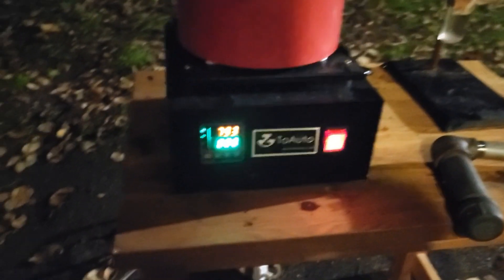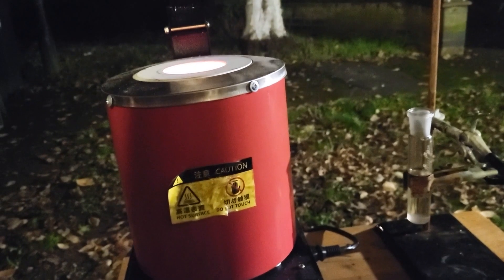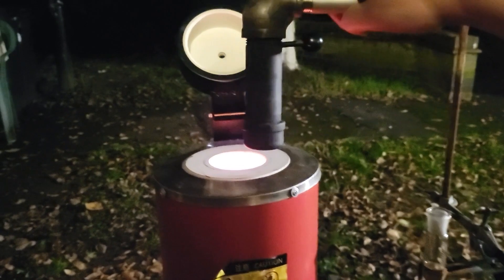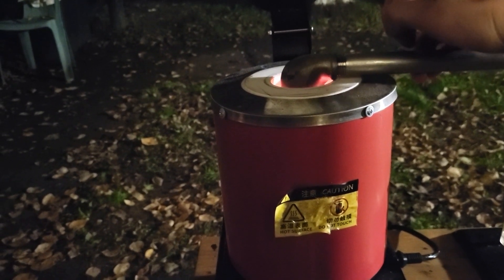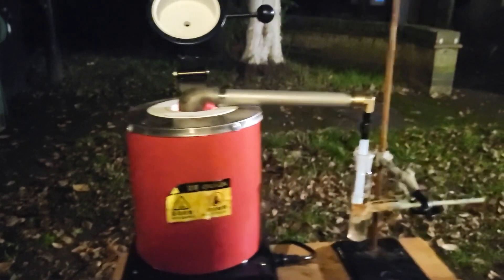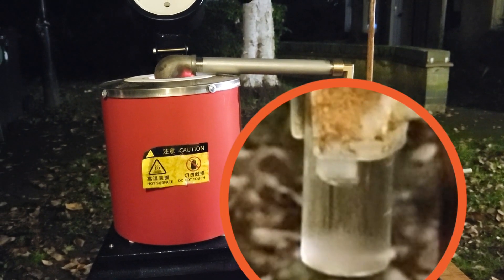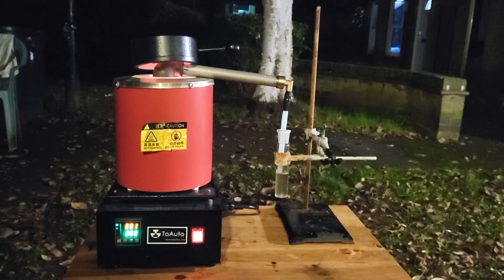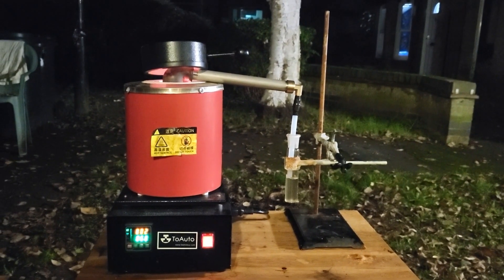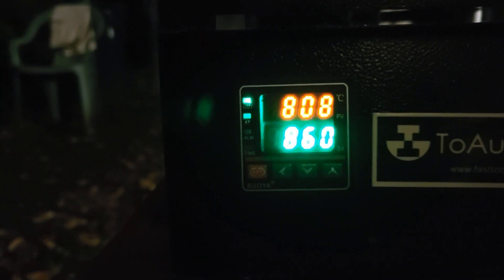We're at almost 800 degrees, so we're ready to put the still inside. Oh, look — bubbles. I think this is going to be a waiting game. It's already been five to ten minutes and nothing's happened. I've increased the temperature to 860, just waiting for it to climb up.